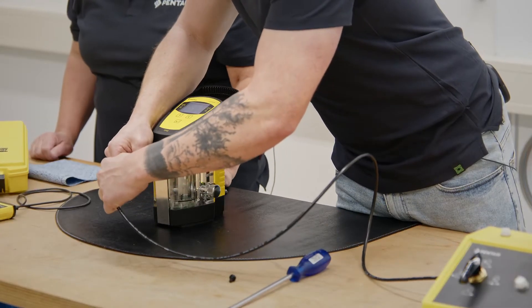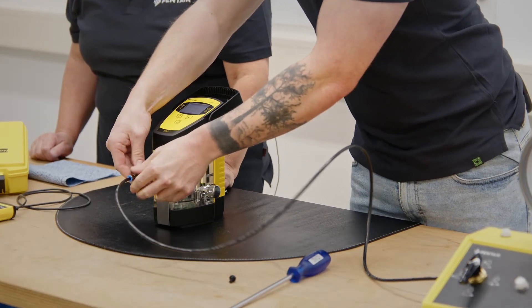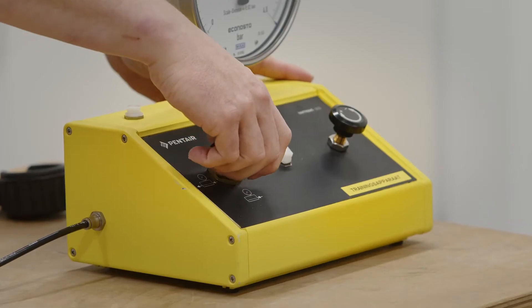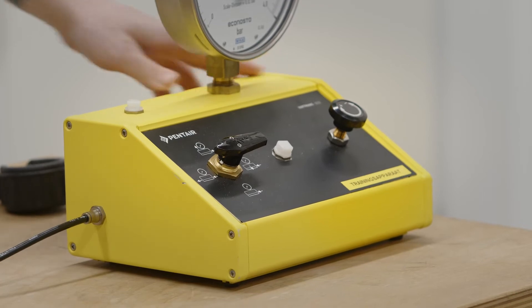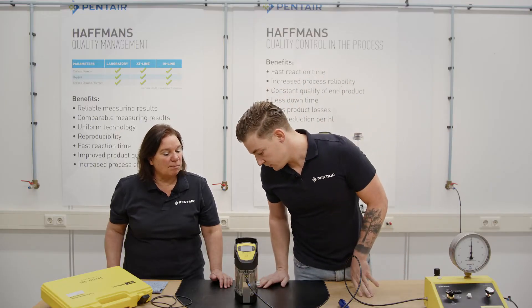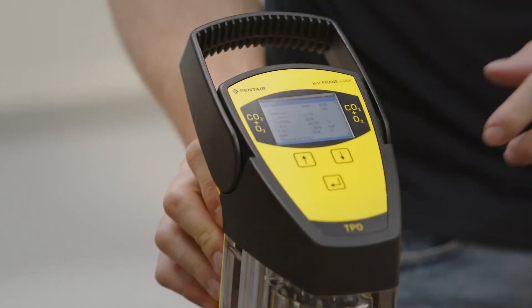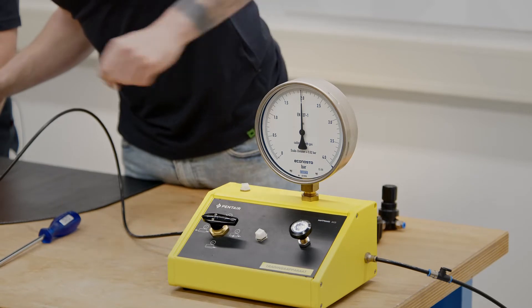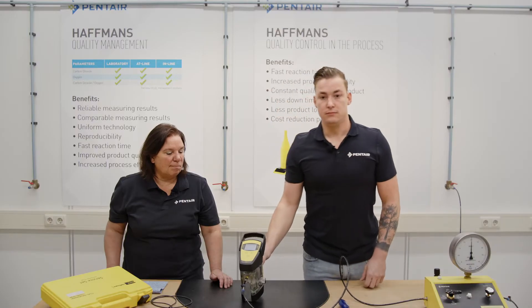You can also use one bar — you just need to know how to compare it to a reference device. Now we compare the pressures. You can see the pressure is the same as what we have on the calibration device, so that's fine.